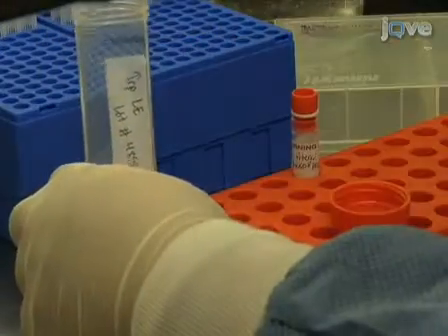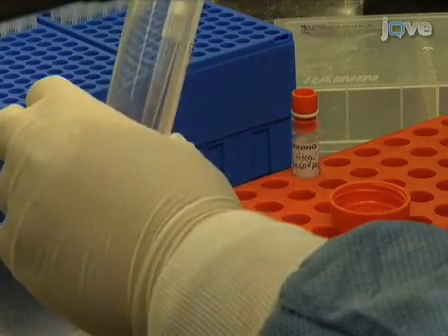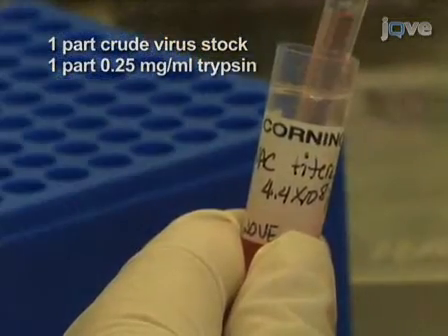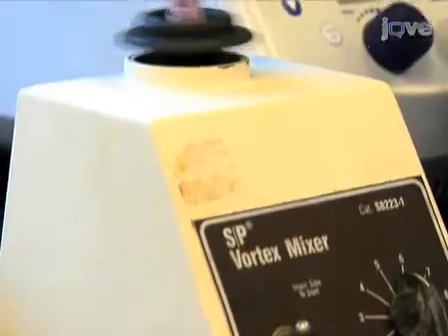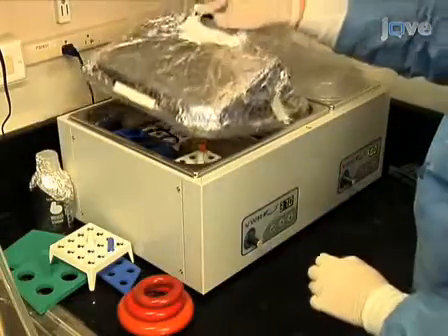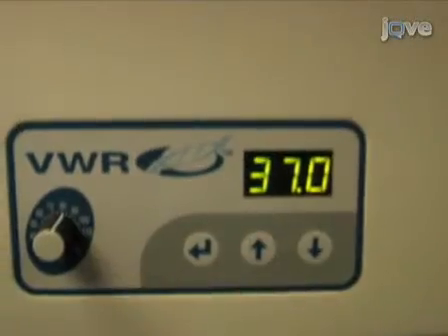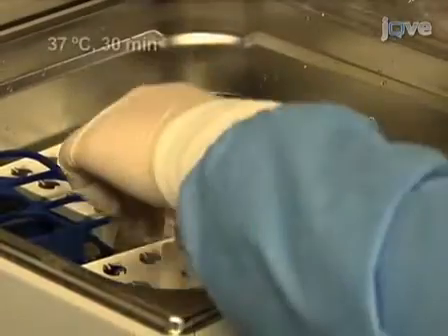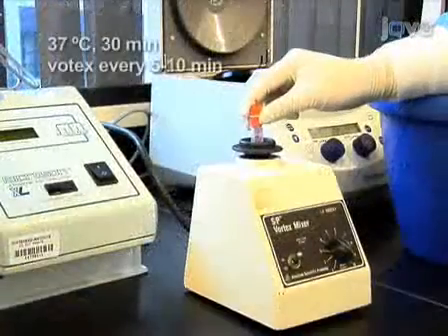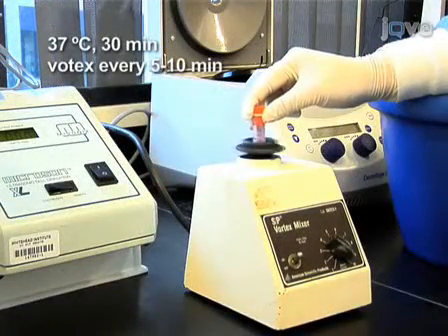If you do not possess a cup sonicator, mix an equal volume of the crude virus stock in 0.25 mg per milliliter trypsin. Vortex vigorously. Incubate the virus stock trypsin mix in a 37 degrees Celsius water bath for 30 minutes. Vortex at 5 to 10 minute intervals.